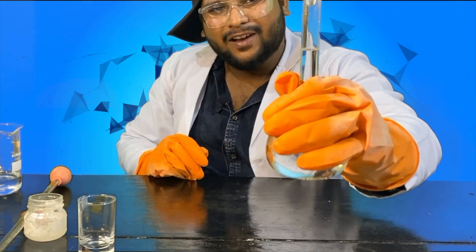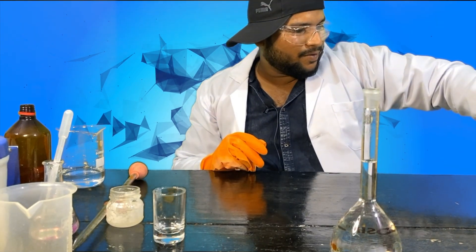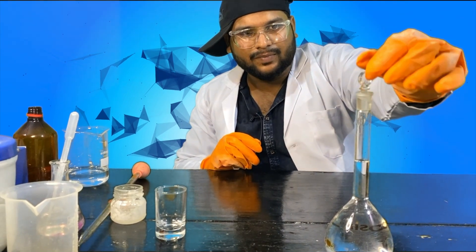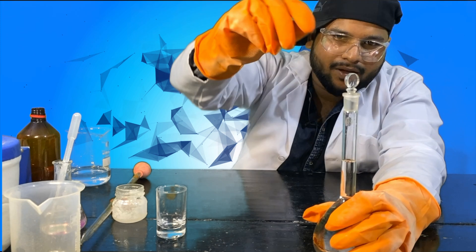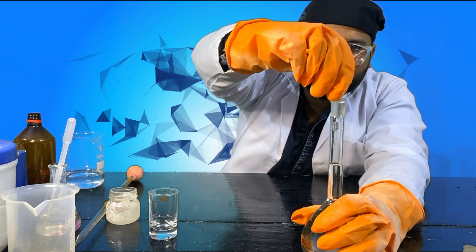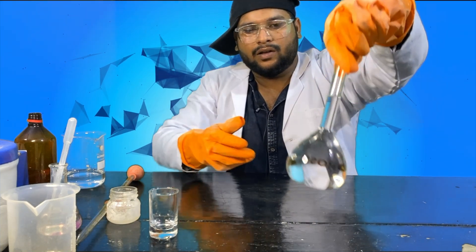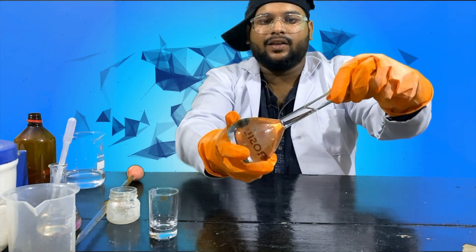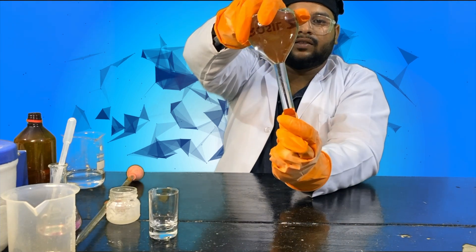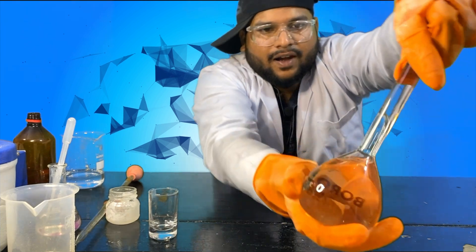Remember, in the realm of chemistry every drop counts and every calculation leads to a breakthrough. Now I need to mix the solution properly — put the cap on, rotate gently in a clockwise direction, hold from the bottom, and invert it upside down, then right-side up again.